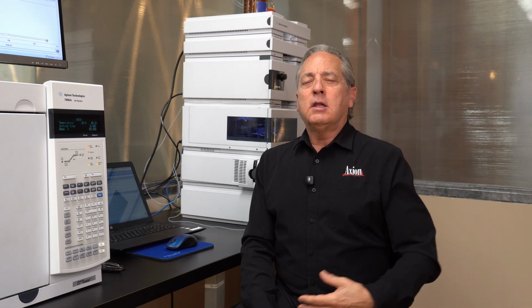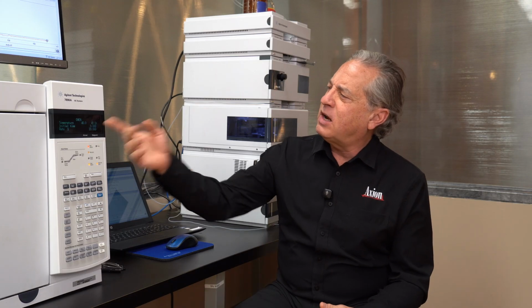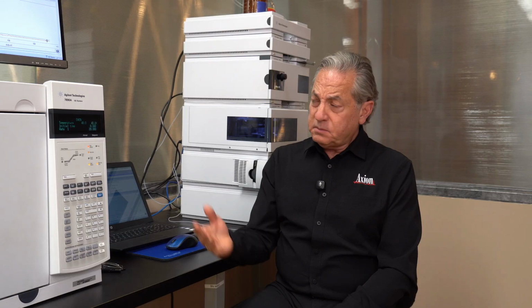So what we're going to do is we're going to try the entire universe of temperatures. What I mean by that is that in GC, the lowest temperature we can use on a GC is room temperature. So I have my GC set at 40 degrees. The highest temperature is dictated by the column, and for mine, the max temperature I'm setting is 300. So you would typically go from room temperature to column max, and that's the entire universe of temperatures.